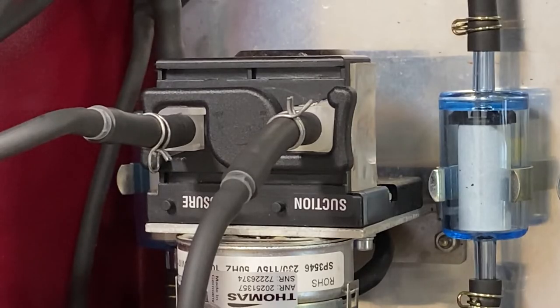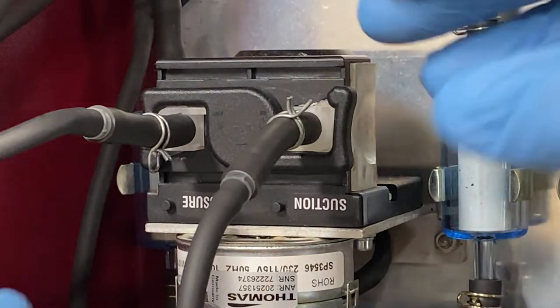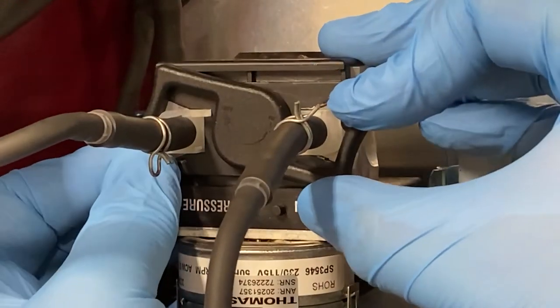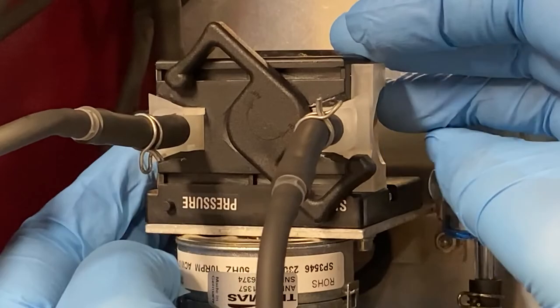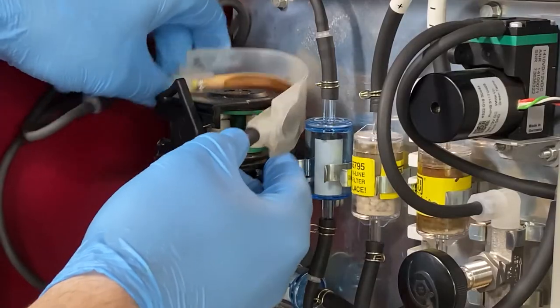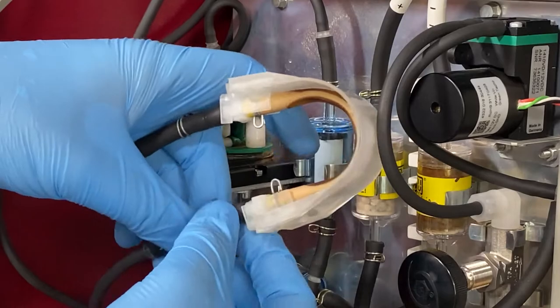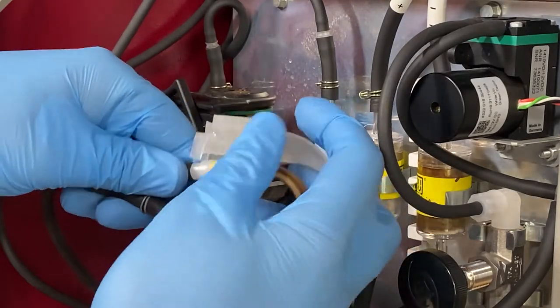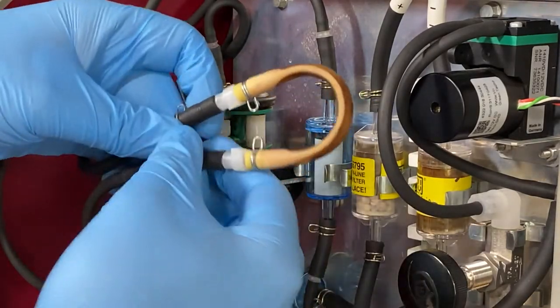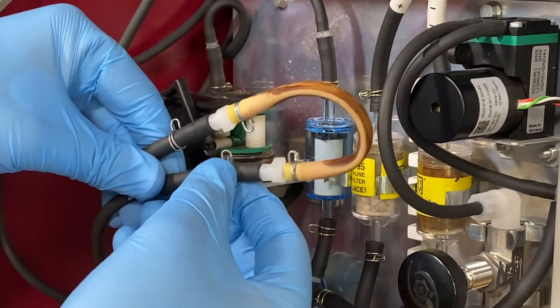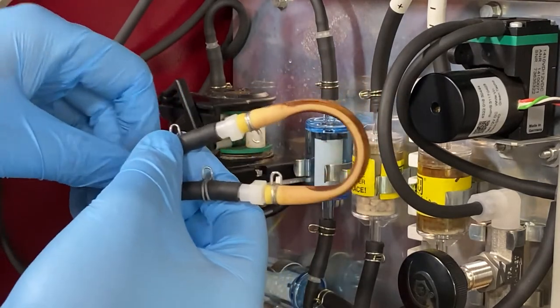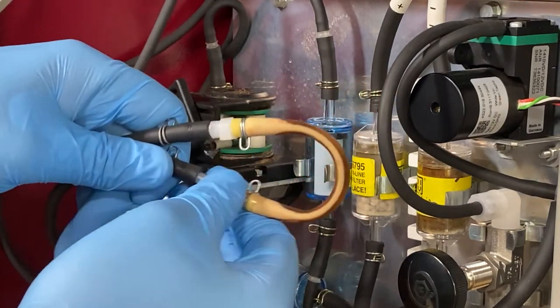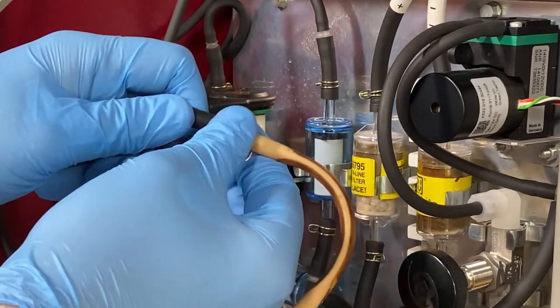To remove the tube, the first thing you'll need to do is unclasp the N-shaped clip on the outside of the condensate pump. Next, remove the plastic covering from the tube. Then unfasten the metal clasps on both sides and remove the tube, ensuring that you take the plugs on both sides with it.